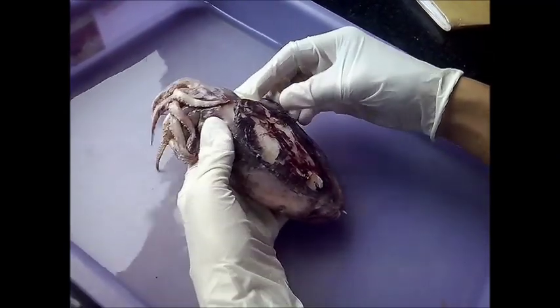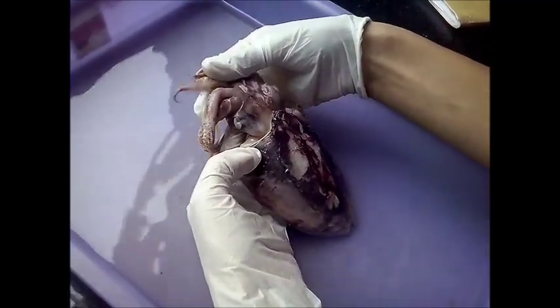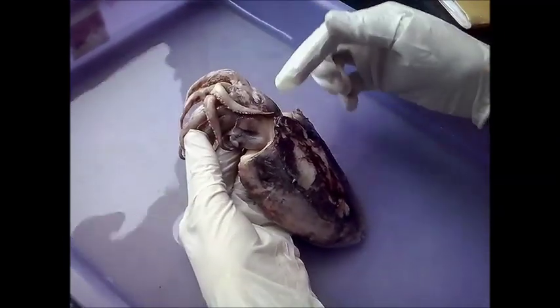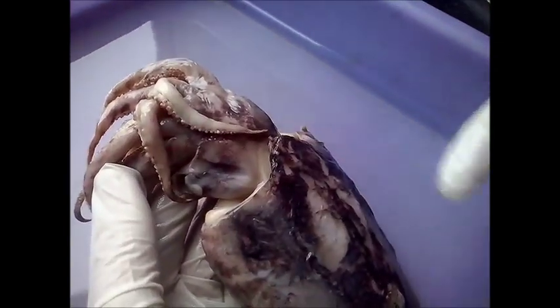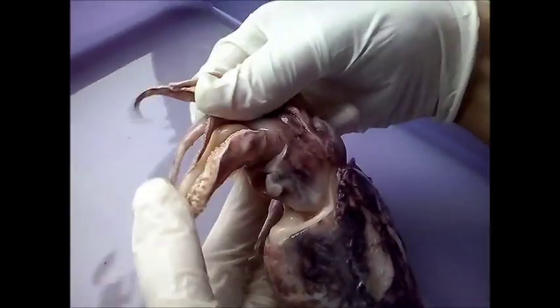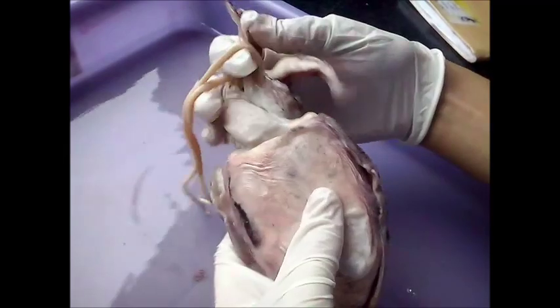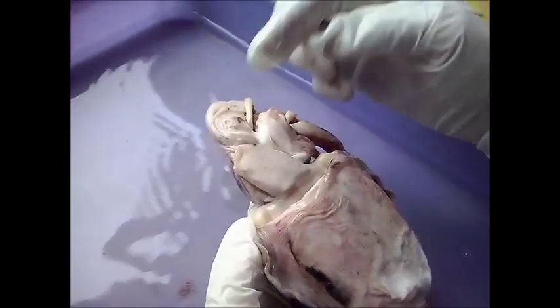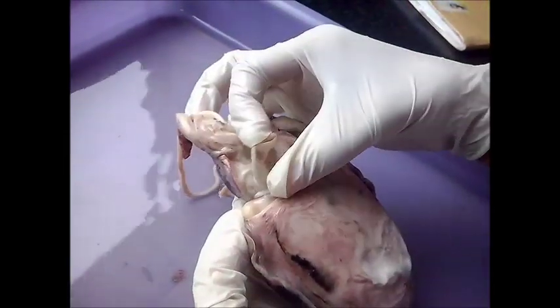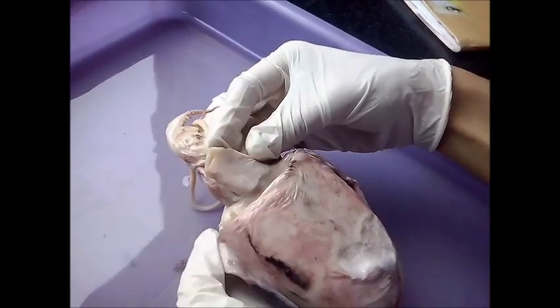On the dorsal side of the head, on the lateral surface, you can see two large eyes. On the ventral side, when you turn the organism around, you will see the funnel or siphon, which is prominent.